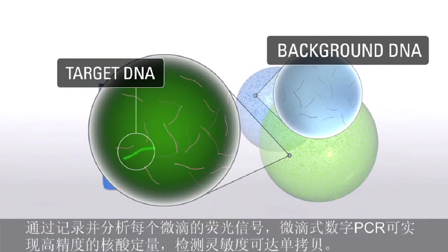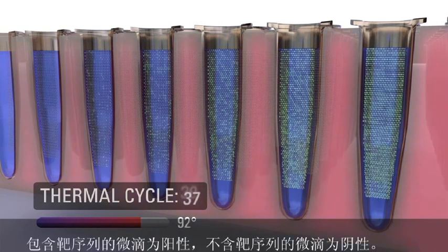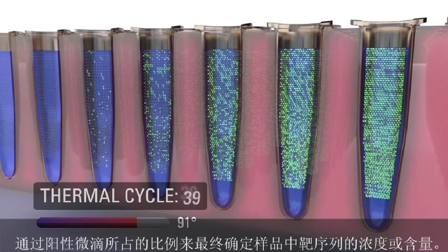fluorescence is emitted. By scoring each individual droplet for a fluorescent signal, droplet digital PCR achieves absolute quantification with a high level of precision and single-molecule sensitivity. To generate digital results, samples are amplified to endpoint in a conventional thermal cycler. Droplets that contain the target DNA sequence are read as positive. Those that do not are read as negative. The fraction of positive droplets determines the concentration of the target DNA sequence in the sample.